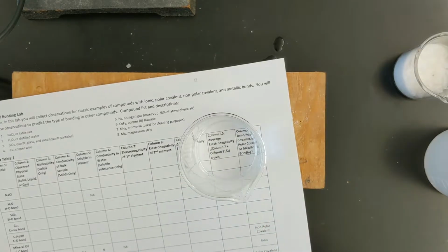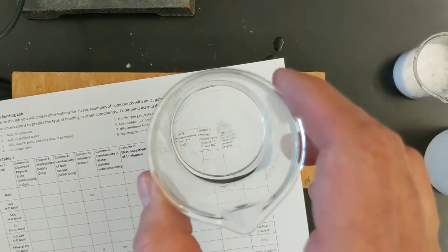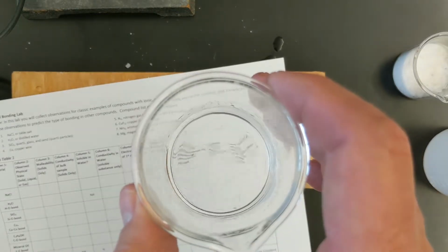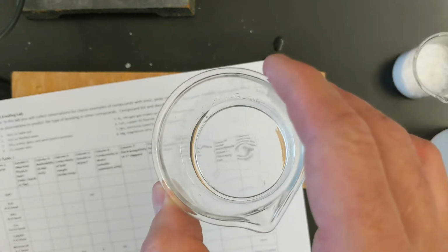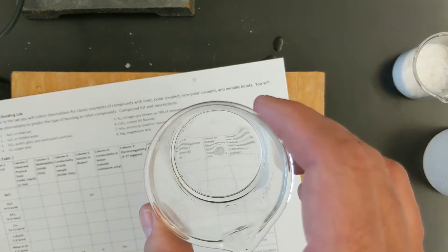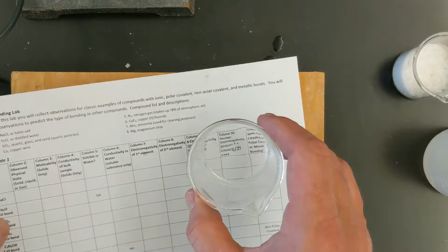If the substance you put in water forms a clear or homogeneous solution, then it is soluble in water. If when you look on the bottom, after you've swirled it and stirred it to try to get it to dissolve, there's still a lot left on the bottom and you've only started with a small amount, then you know it's not soluble. Also, if the water gets cloudy or murky, you know it's not soluble in water because it's just kind of suspended in there and it's not translucent. So salt is definitely soluble in water.